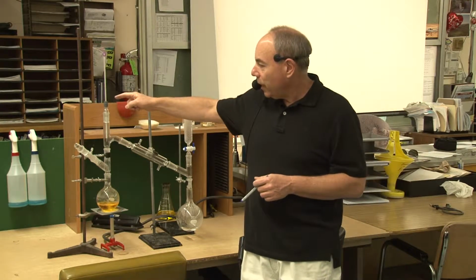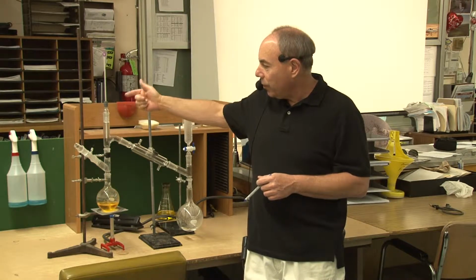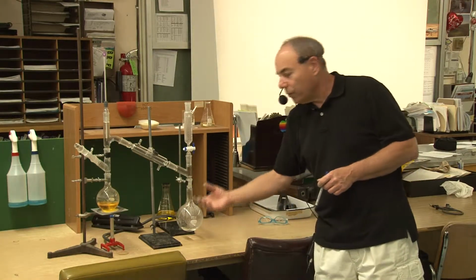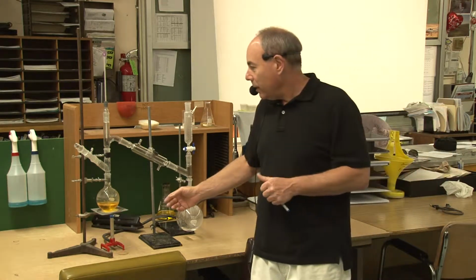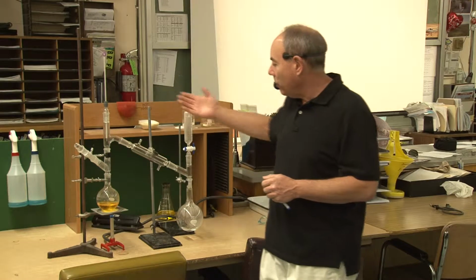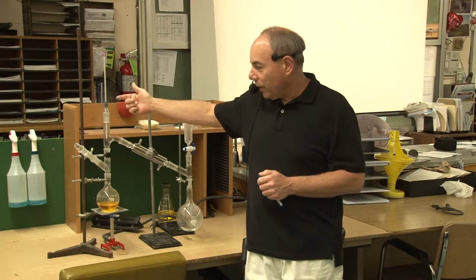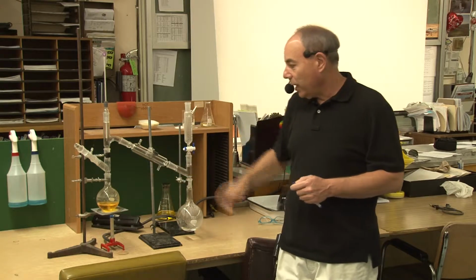I could monitor the temperature at 39 degrees, and then as soon as the temperature started to rise, I would know that the lowest boiling point liquid would be all the way over. I'd remove the receiving flask and collect that liquid, put it back, okay, and then let the next liquid boil over at 68 degrees, and then when it started to rise, I would pull the receiving flask off and collect that liquid. And then finally you'd end up with pure water in that flask over there.